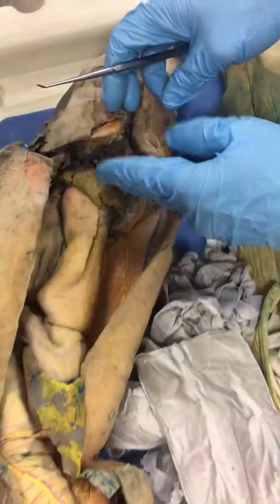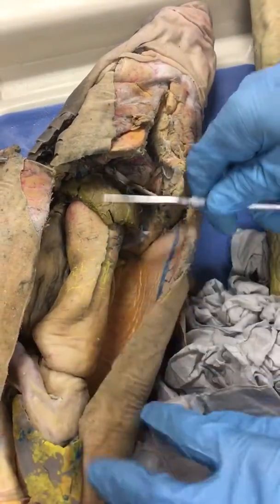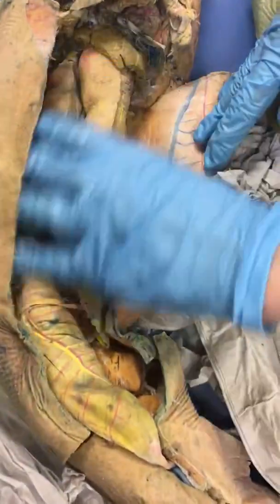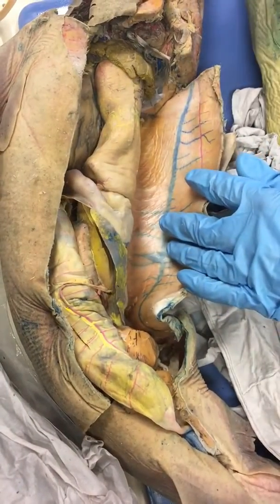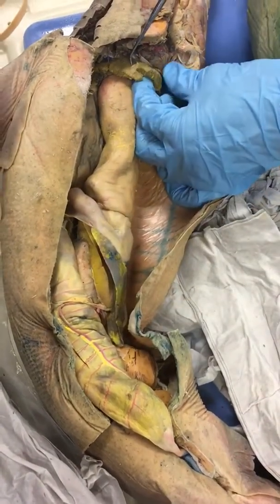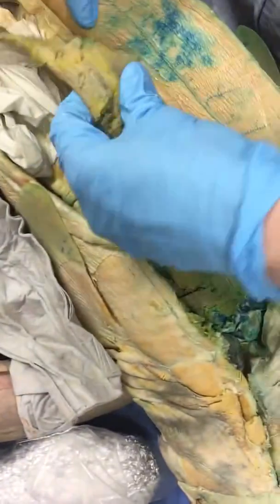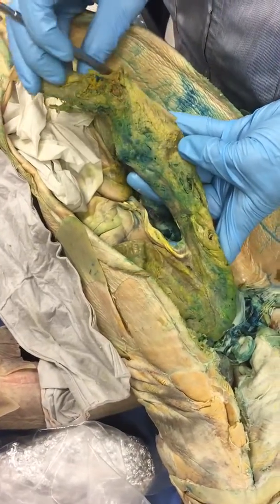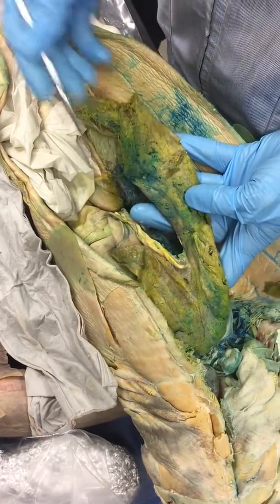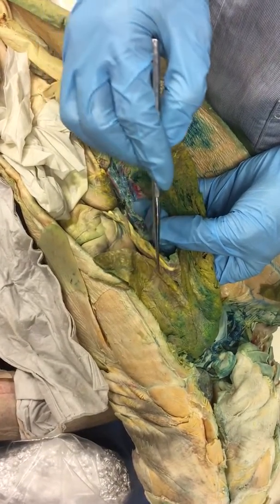So the pleuroperitoneal cavity runs from here, the top of the liver, down, and it's that space that holds all these organs. The liver is cut on this one, so we'll go over here to this one. So this is the liver. This here, the sac, is the gallbladder.